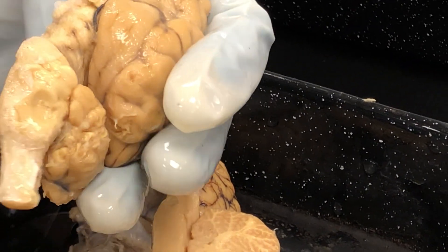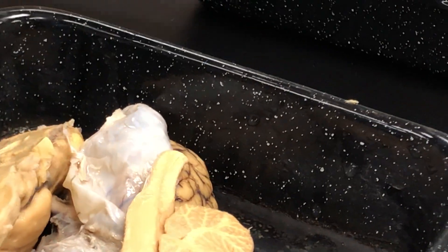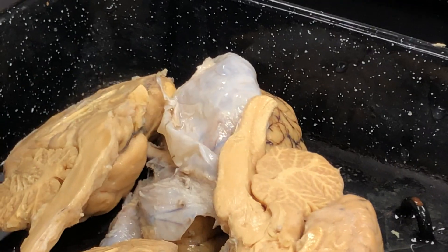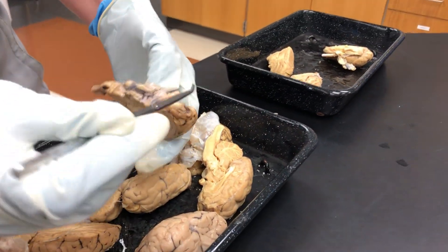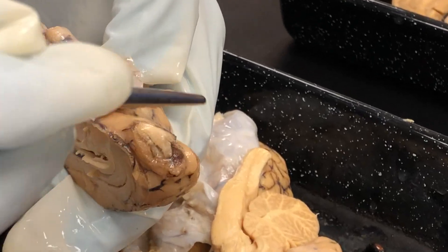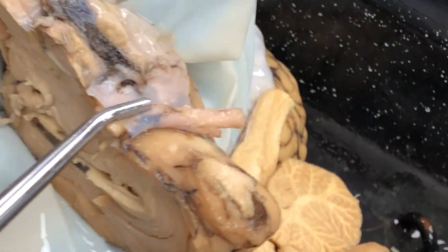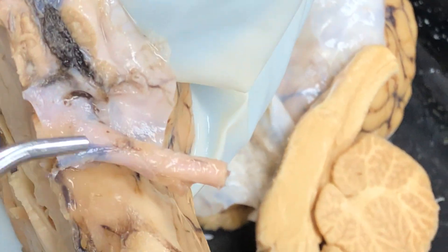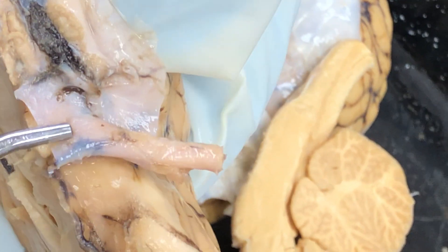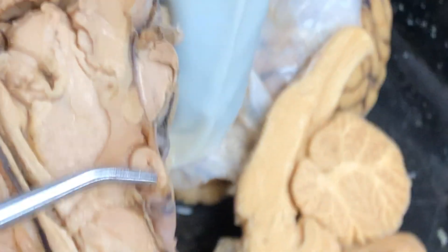That takes us right to the ventral view. We can start by looking at the optic nerve on the ventral side of the sheep brain. The optic nerve is this thing right here, leading from an eyeball to the structure where the optic nerve on both sides come together to form the optic chiasm. So this is the optic nerve, and it comes into the optic chiasm right here, which you can see very clearly in the sagittal view as well.